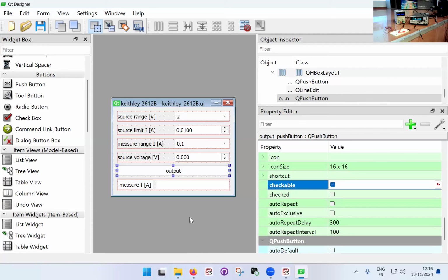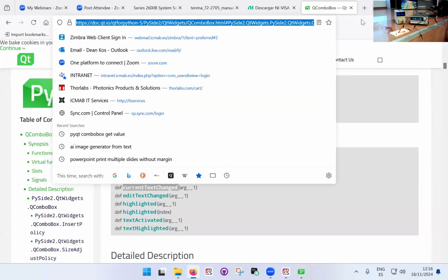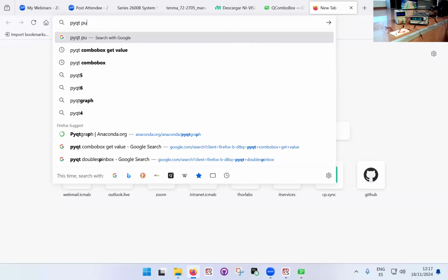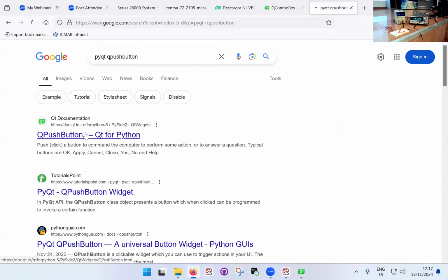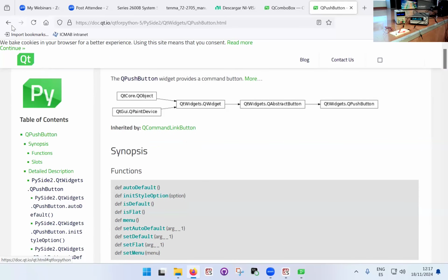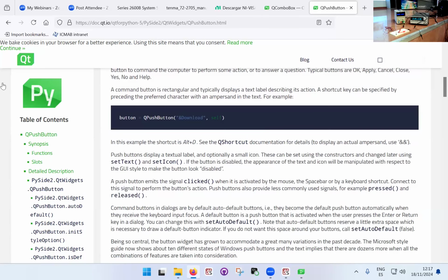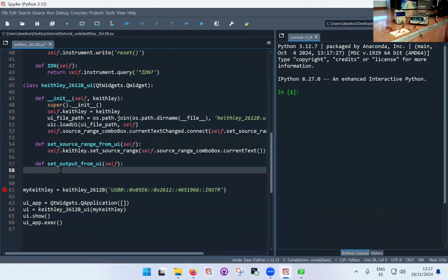And then what I want to do is, when I execute the function, I want to see if the button is in the on state, is checked, or the button is in the off state. So again, here I have to go to the documentation. I'm just going to open a different tab, pyqt push button. Right, well, we ended up in a bit of a rabbit hole of this whole Qt business, in the sense that the push button is a very general object. So I'm just going to put it right from my notes, so you know which commands to use right away. Just bear with me one second.